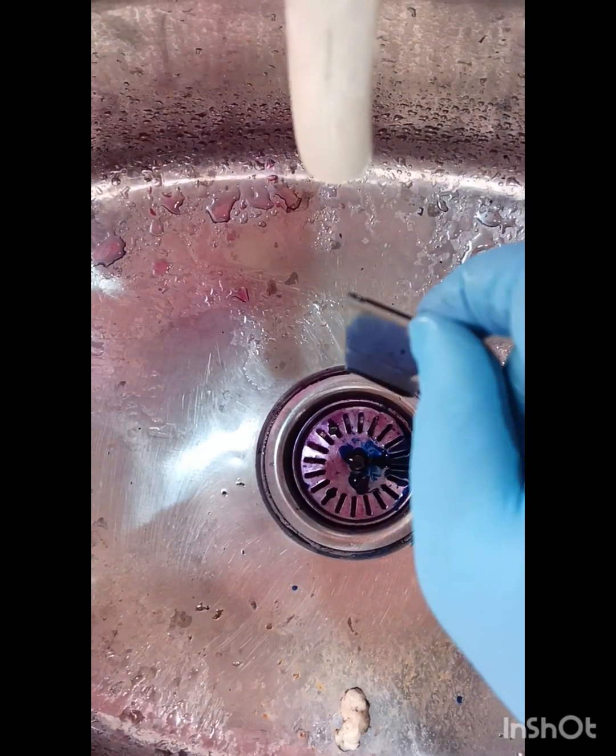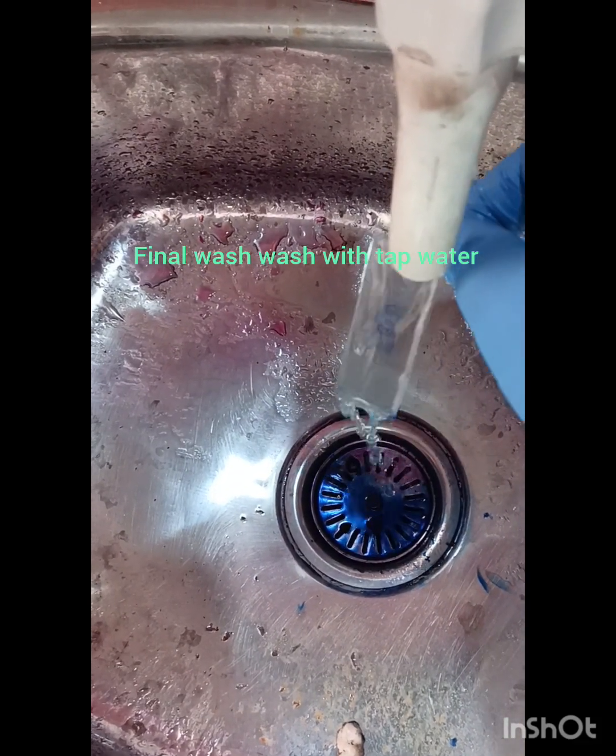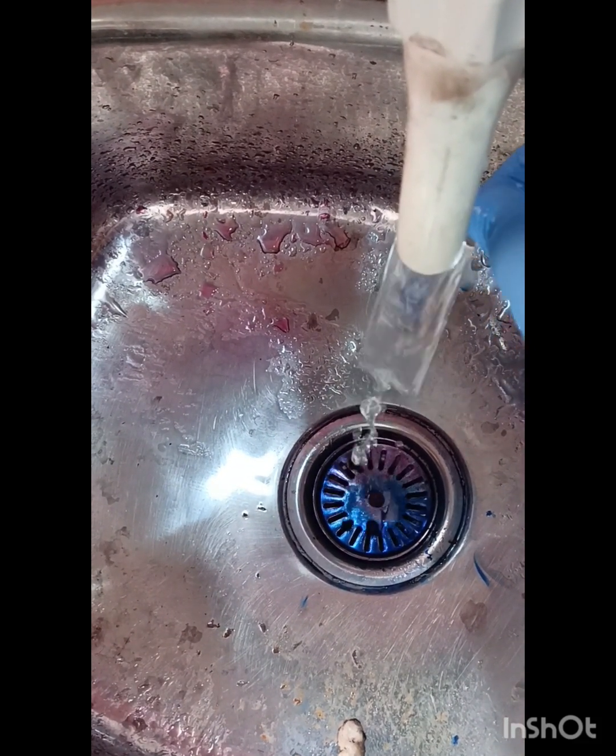After that, we put methylene blue as a counter stain and allow it to hold for 30 seconds. Discard the methylene blue and wash it properly with tap water.